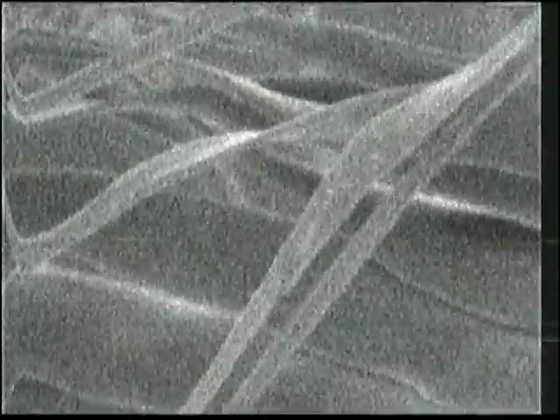So we can look for different structures. Actually, that's not the only shape in the feathers. That was the shape I found. But if we want to look, I'm going to spend a little extra time here looking along the feather. You can see that the feathers do have different cross sections.